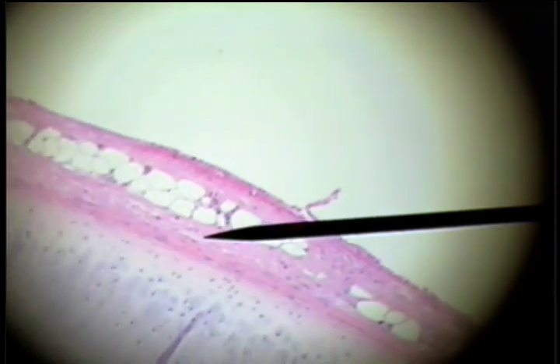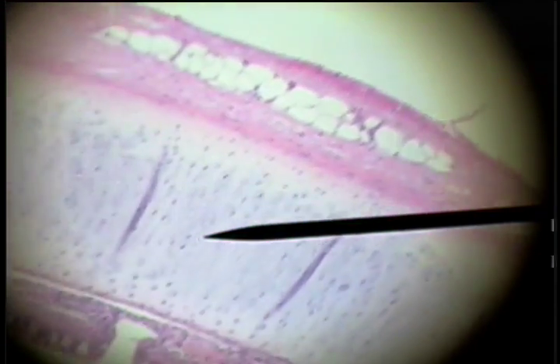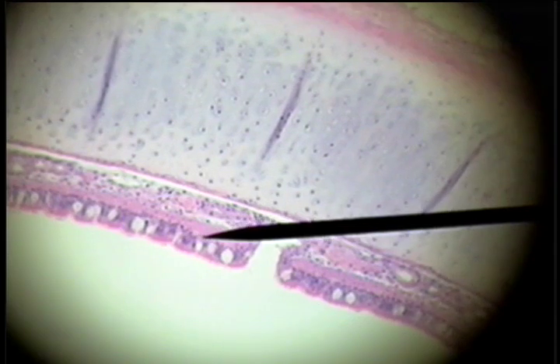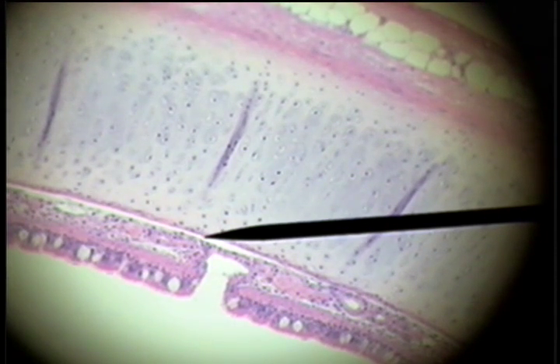This specimen is taken from the trachea. Here's the outer wall of the trachea. This is connective tissue extending to the basement membrane here, and then the pseudo-stratified ciliated columnar epithelium on the inner surface of the trachea. In the connective tissue is this supporting hyaline cartilage.